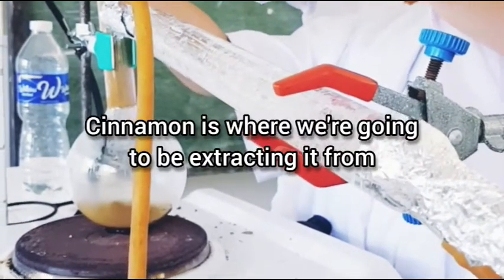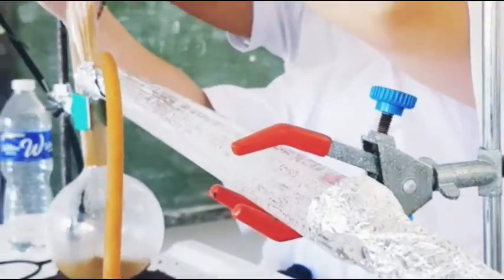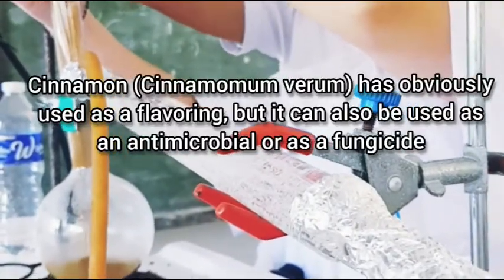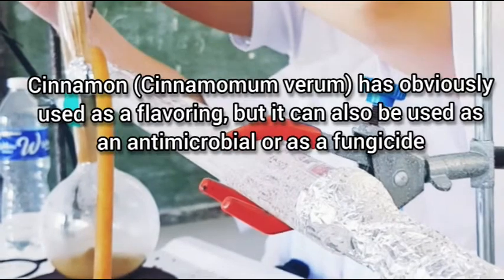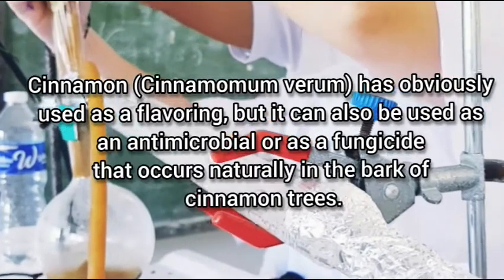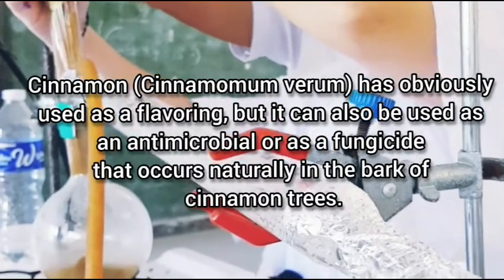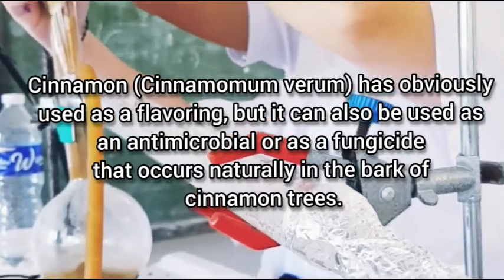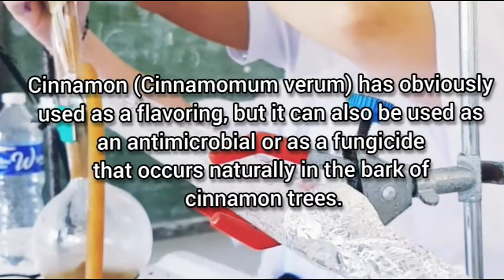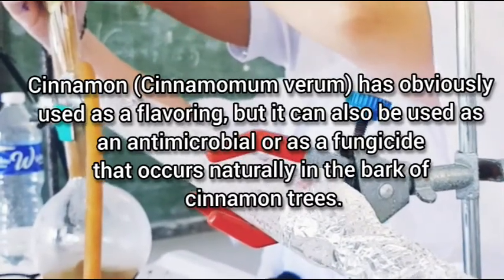Cinnamon is where we are going to be extracting it from. Cinnamon is obviously used as flavoring. It can also be used as an antimicrobial or as a fungicide that occurs naturally in the bark of cinnamon trees.